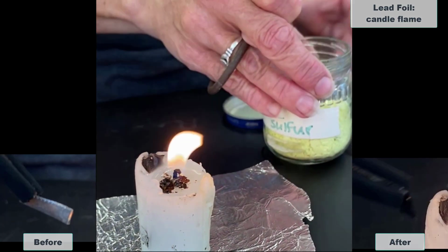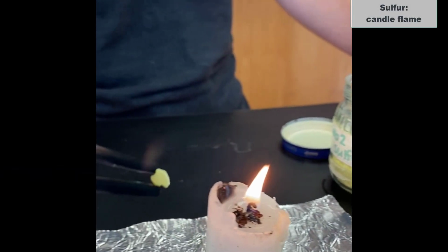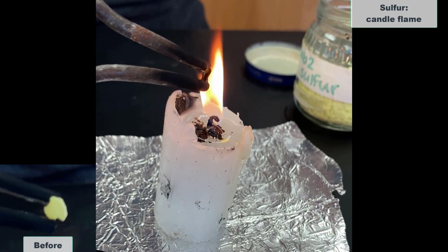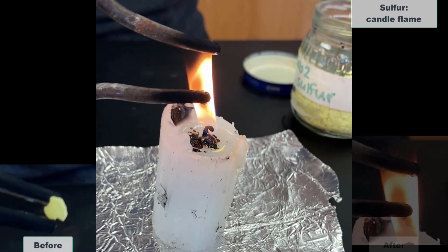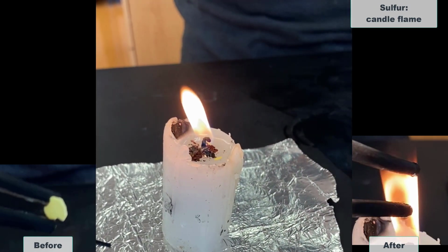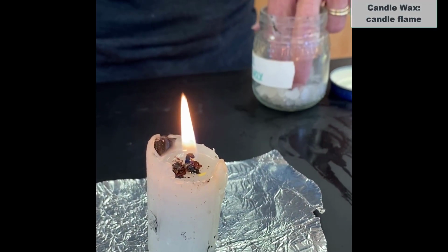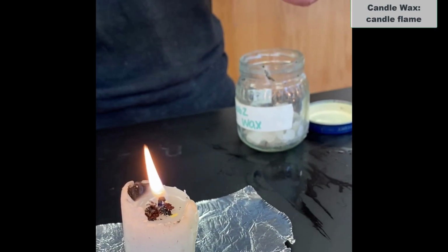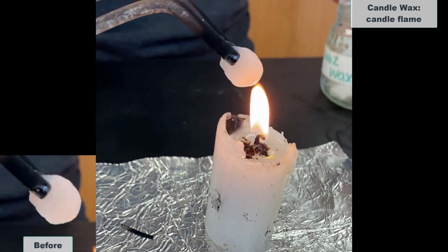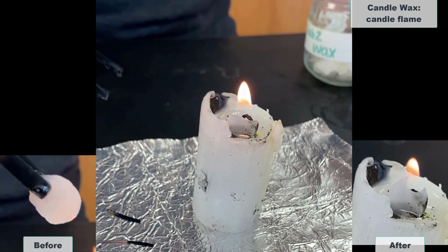This is sulfur. Hope I can get a big enough piece that you can see it. Okay, and in the flame. And that's pretty much gone. And the last one we're going to test is candle wax. Oops, my tongs are actually hot. Here's our candle wax. And I think we all know in a candle what candle wax does. And there we go.